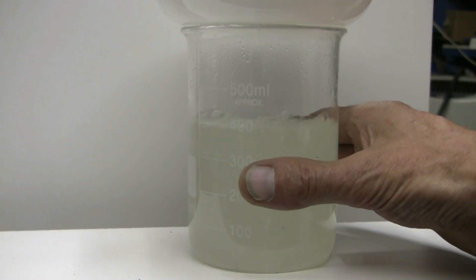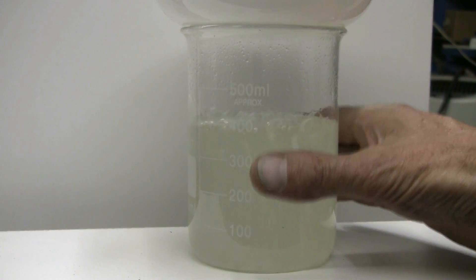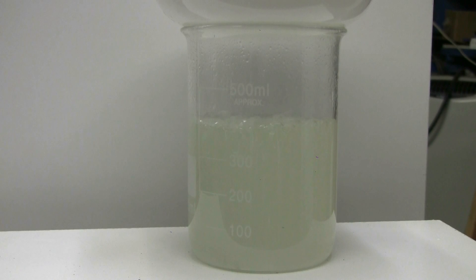The temperature's risen to about that of hot water, maybe 120 Fahrenheit. That's as hot as it'll get here. But if the bleach had been even more concentrated, this would have foamed right up and out of the beaker.